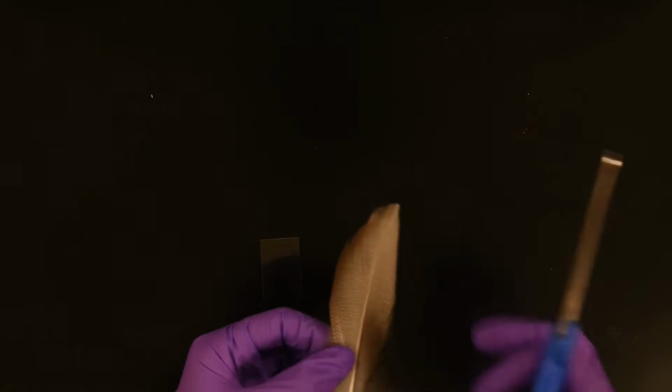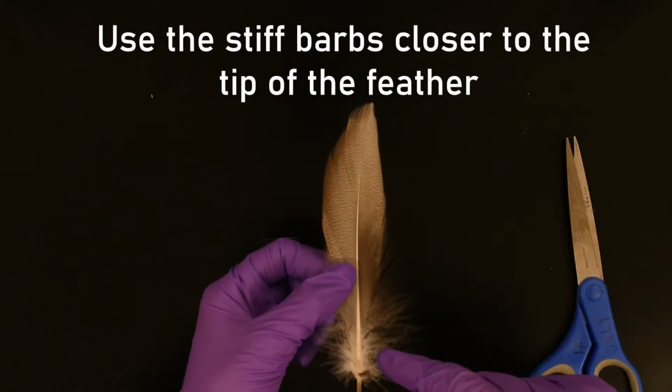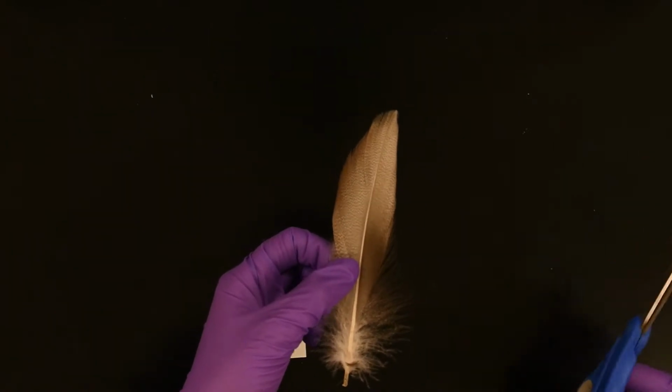To prepare the contour feather, we are going to cut off a piece of the top feathers that look a little bit different than the down feathers. You can try to cut more towards the top of the feather.